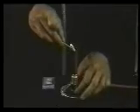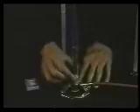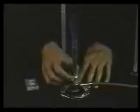This should produce a pale blue or orange-yellow flame of about 15 centimeters high. Start opening the air inlet by twisting the bottom collar of the barrel. Do not touch the top, it is hot. Adjust the air until a double blue flame results as shown. To shut off the burner, close the gas tap on the bench.